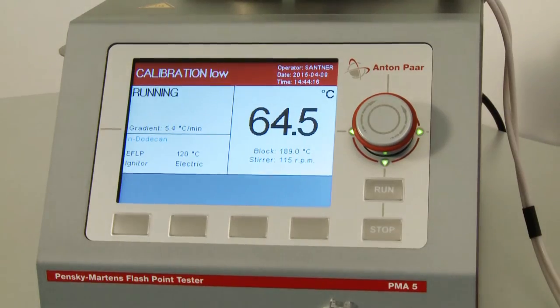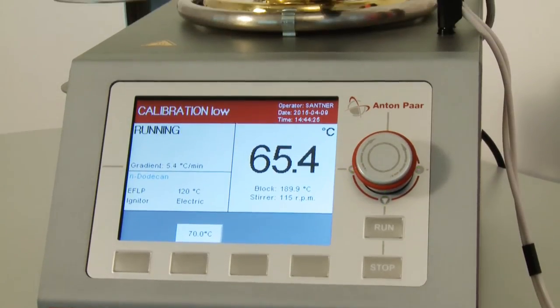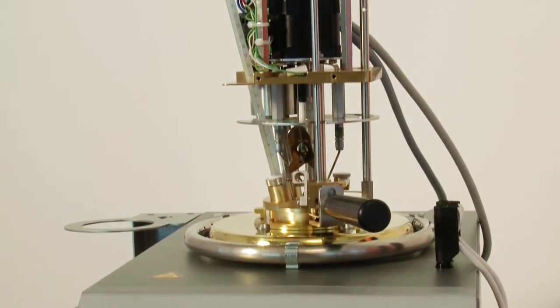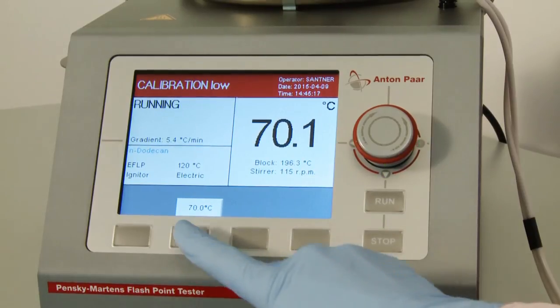How does the calibration work? Well Tony, we have certain calibration temperatures. On the soft keys here, you can see when the PT100 has reached a certain calibration temperature. The instrument gives you an acoustic signal about 5 degrees before the temperature is reached. Now you can read the temperature of the thermometer. Once the calibration temperature is reached, you can confirm this by pressing the soft key.